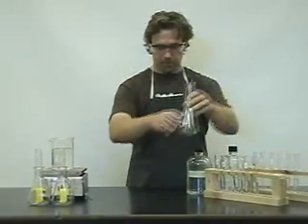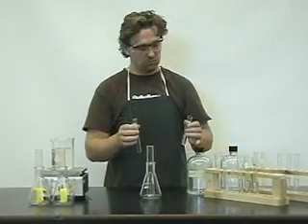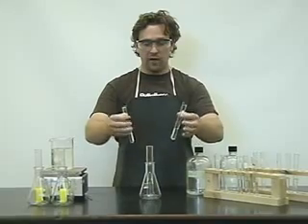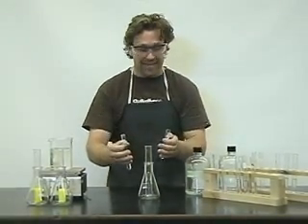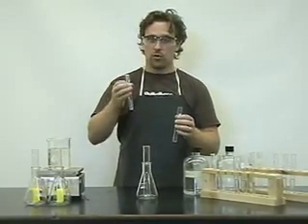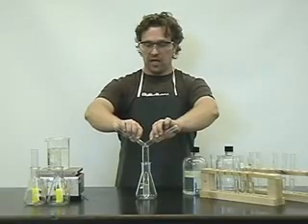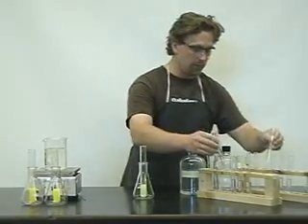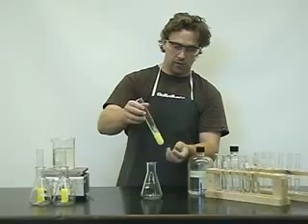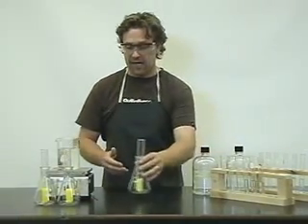The third test tubes are further diluted: 6 mL of potassium iodide and 6 mL of lead nitrate, diluted to 10 mL of water. We're varying the concentrations to see whether a precipitate will form — in essence, we're calculating the trial Ksp. If the trial Ksp is larger than the Ksp, a precipitate will form; if it's smaller than the Ksp, a precipitate won't form. By varying concentrations, we find the approximate concentrations at which the Ksp does and doesn't lead to precipitation, and the true Ksp for lead iodide will fall in between.